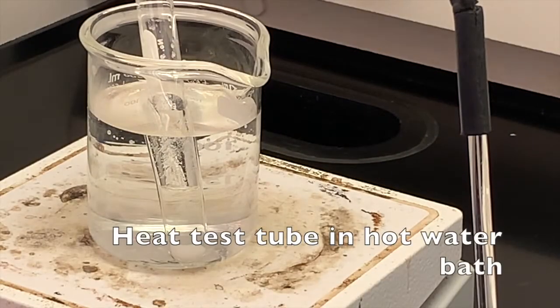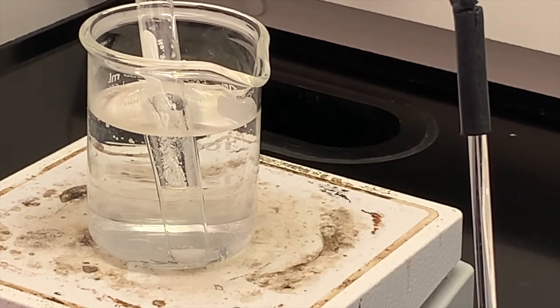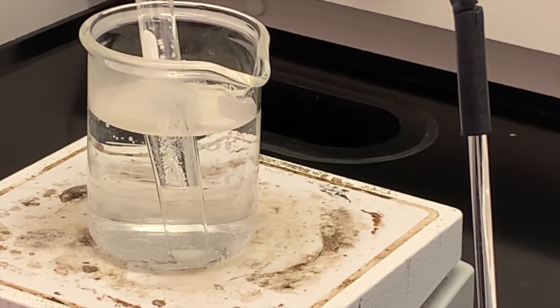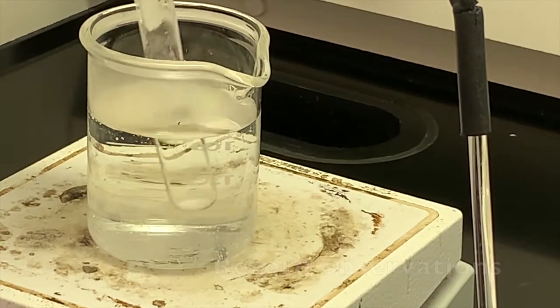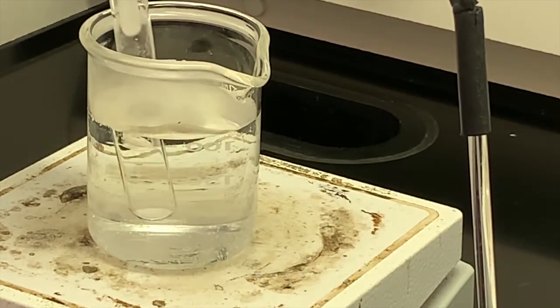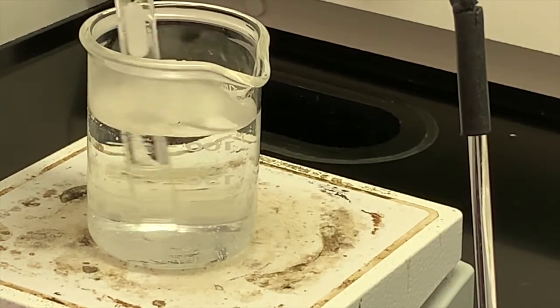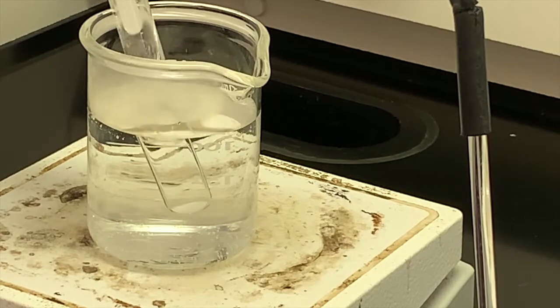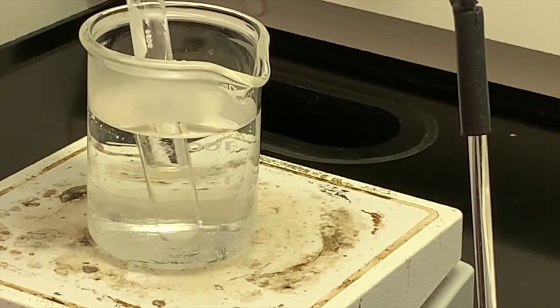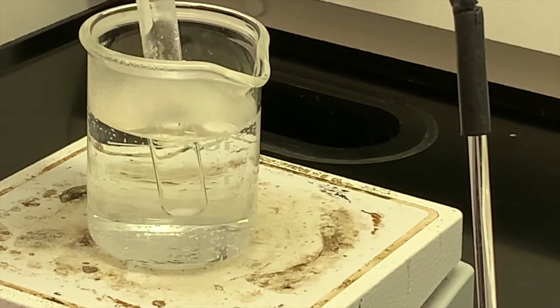So as our water has heated up and we put our test tube in this hot water bath, you can see that we have less of that solid that's in our solution. We don't see as much on the bottom of our test tube.